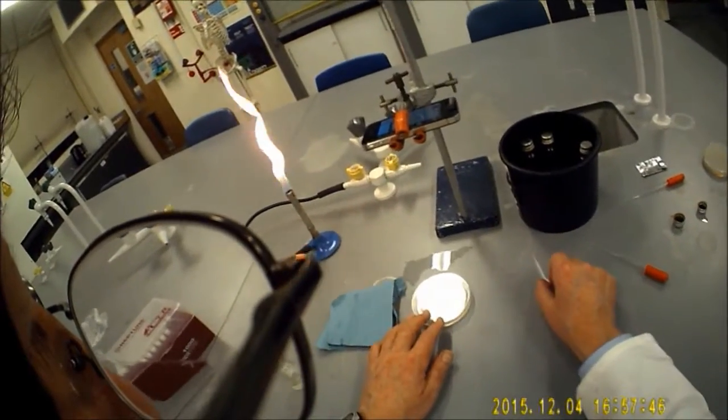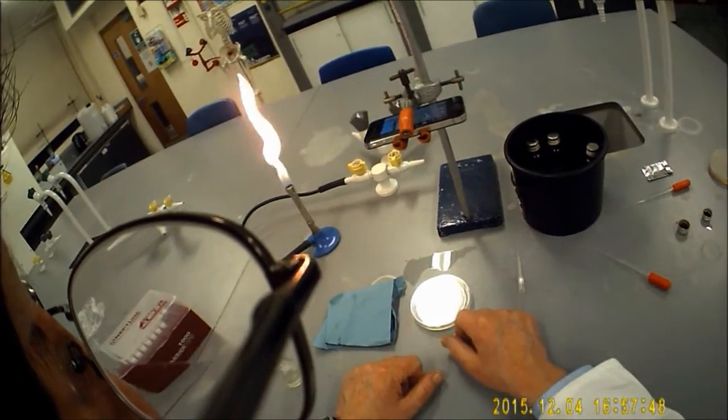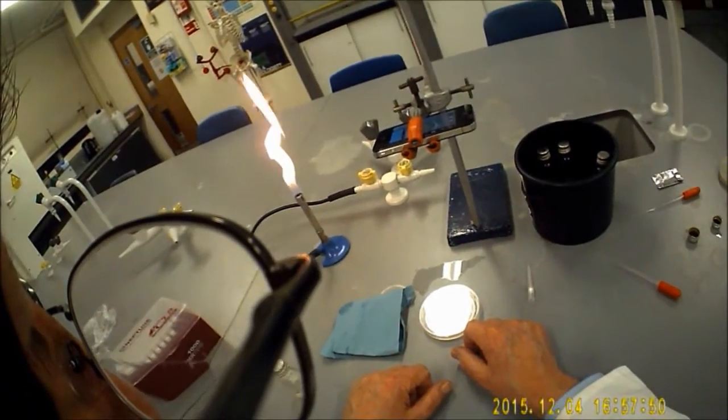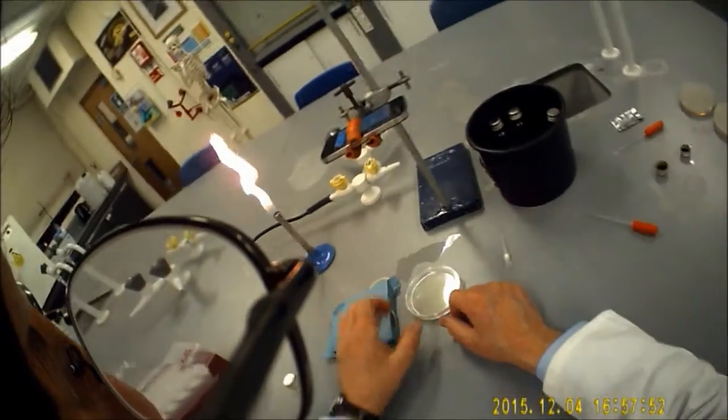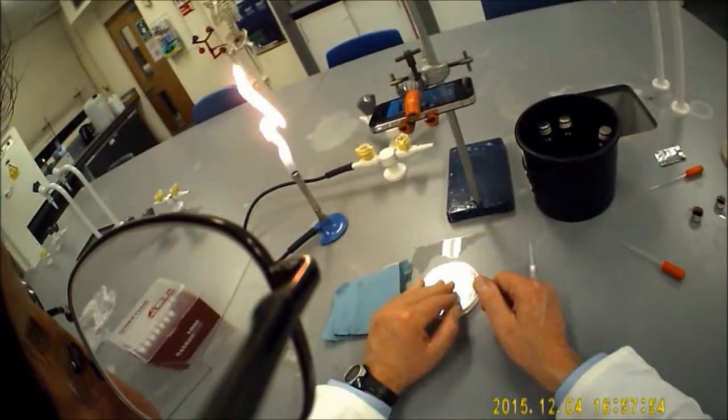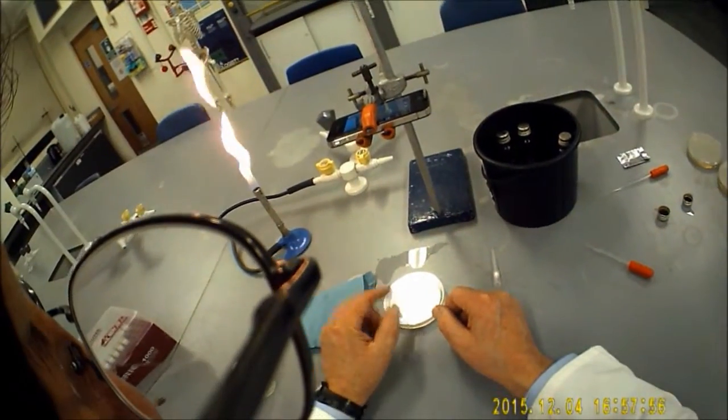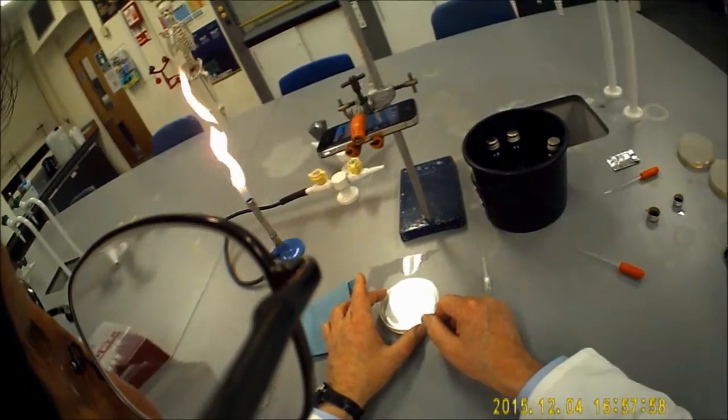So my plates have set now, so what I'm going to do is show you how to take a well out and how to seal the well. You can see that it's nicely set there.